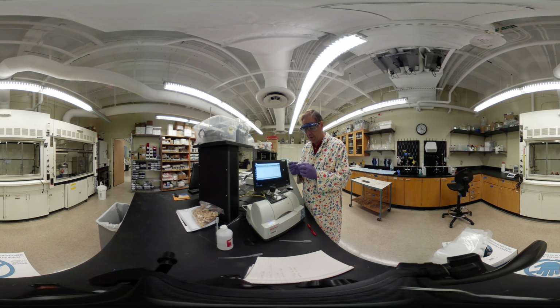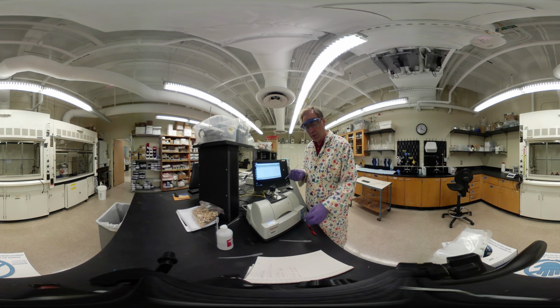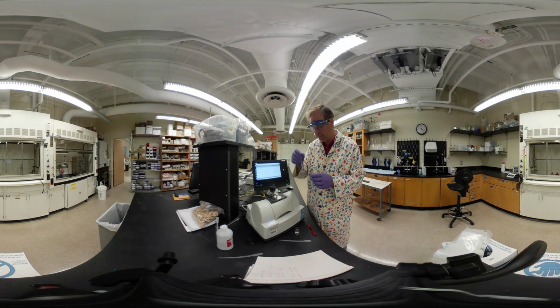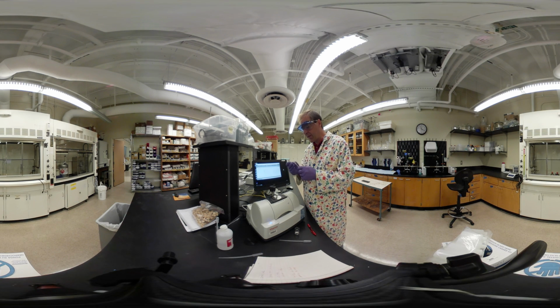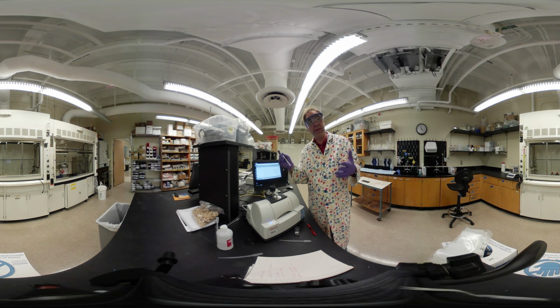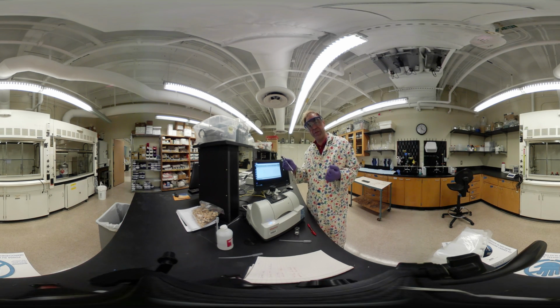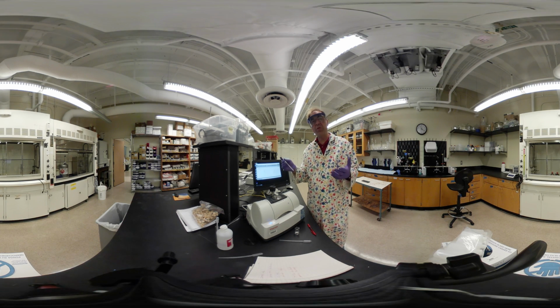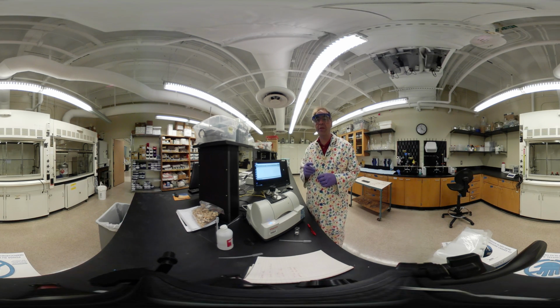What I just do is get a little bit of solid in this. It doesn't actually take that much. It's one of the advantages of NMR. Okay, so I just have a little bit of solid in the bottom. And then I'm going to add to it, in this case, D2O, deuterium oxide, as my solvent, because I need an aqueous solvent, but I want to make sure that it's not just water, because then the protons of the water would overwhelm the signal of the protons from my product. So we use the deuterium oxide because the deuterium is not NMR active.